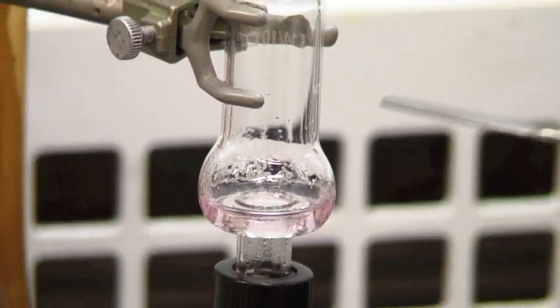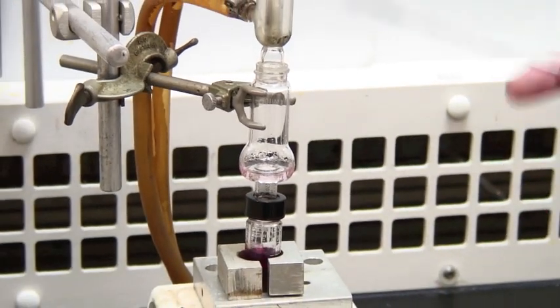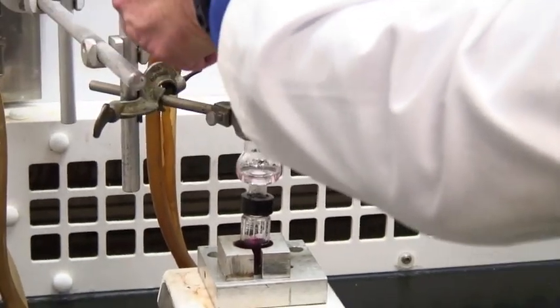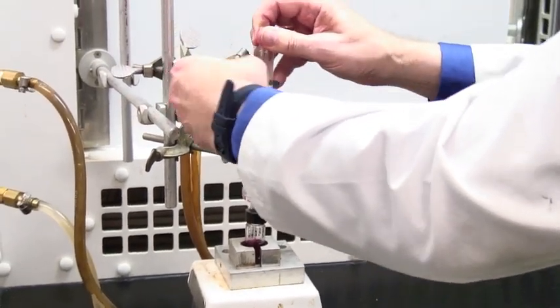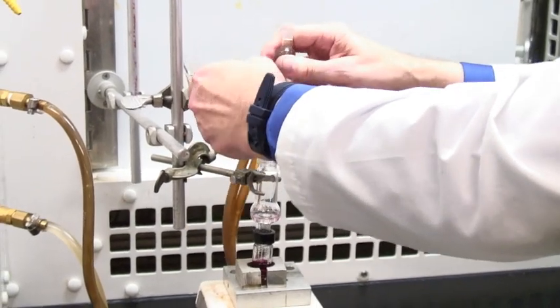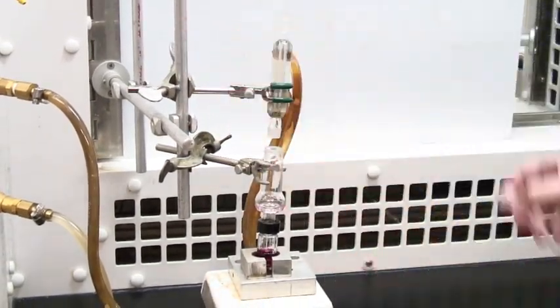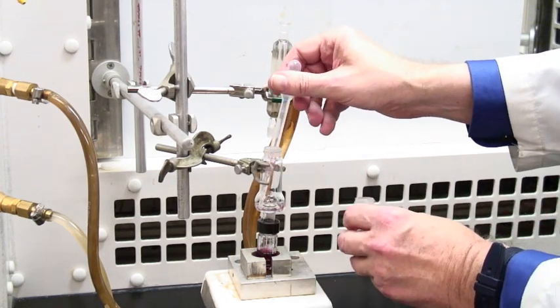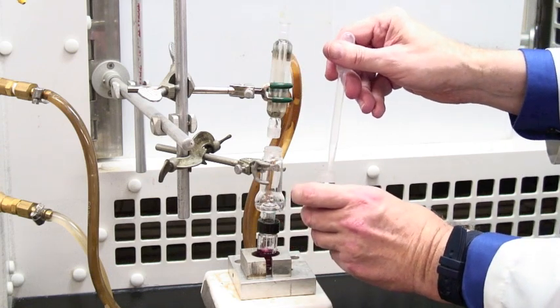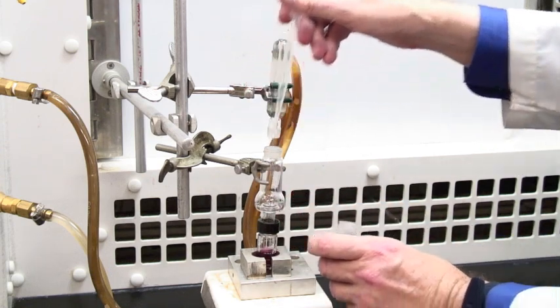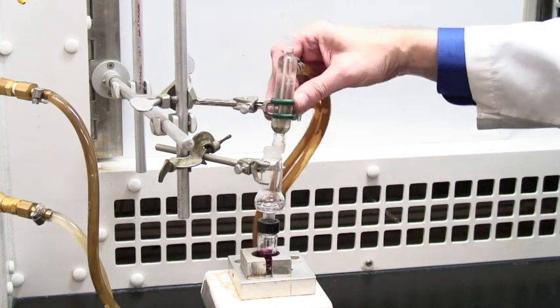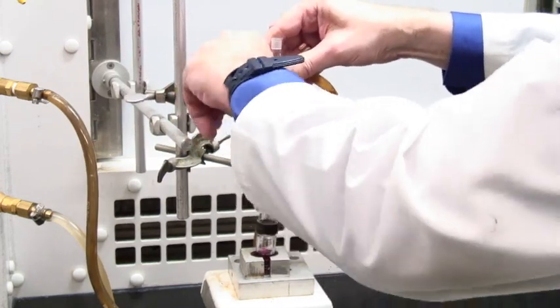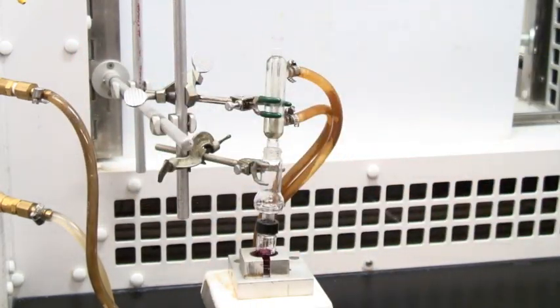The well is filling up, and so what I'm going to do now is take some of the distillate off. To do this, I need to raise the condenser a bit. Out of the way. Take my plastic tip. Sometimes it helps to bend the tip a little bit. And remove my distillate. Put it into a vial. Nice yield there. And this has still got liquid in it, so we can actually keep distilling. So there we are. And we can continue to get a second crop from that.